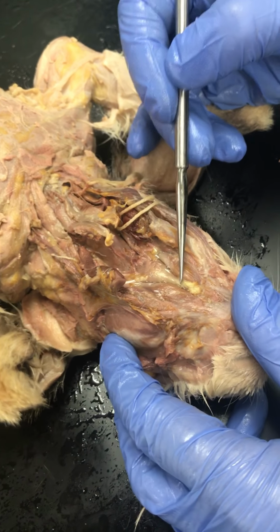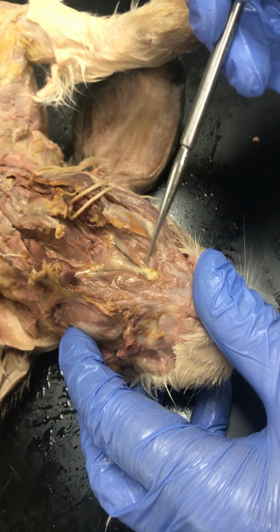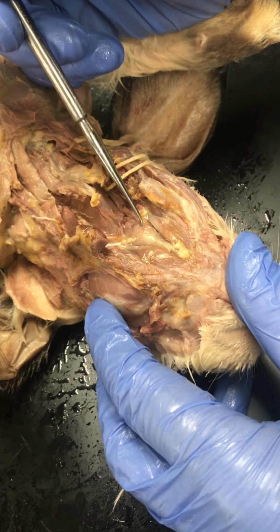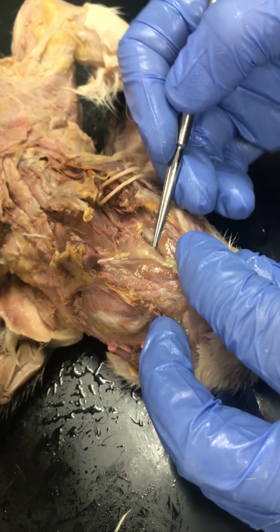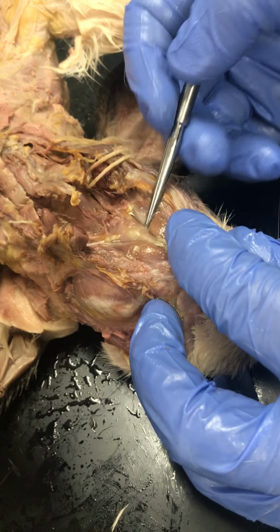Okay, that's the masseter. And then once we get down to the neck, when you start peeling this, the first ones you're going to see are the digastricus. They kind of make like this little V shape on both sides. So this is one of the digastricus, and this is the other. And then we have the mylohyoid. Underneath the mylohyoid, you can just point to it on your quiz, but that's the geniohyoid. Okay, so again, the mylohyoid and then the geniohyoid.